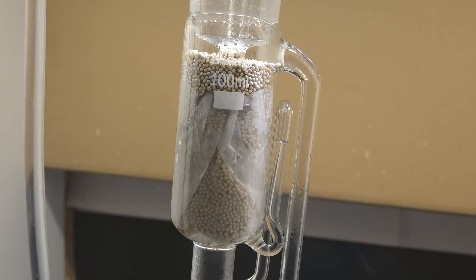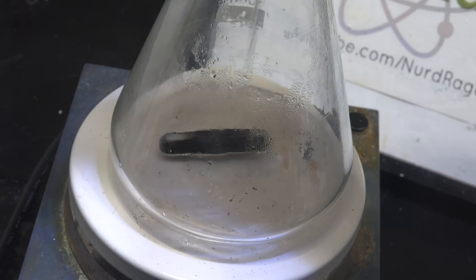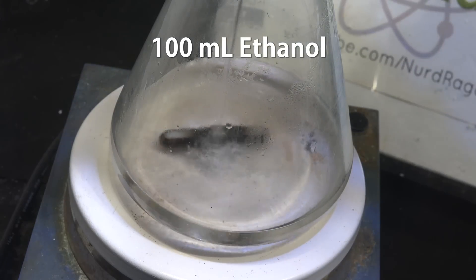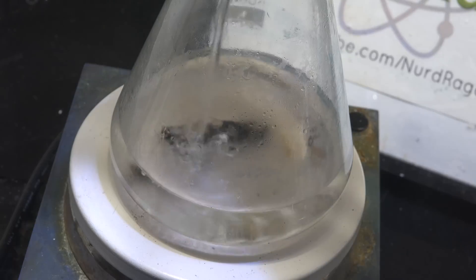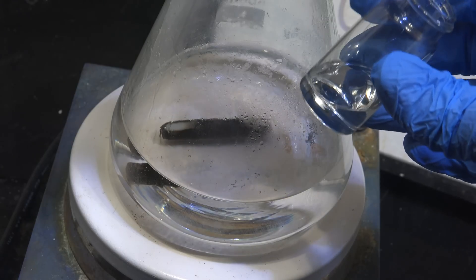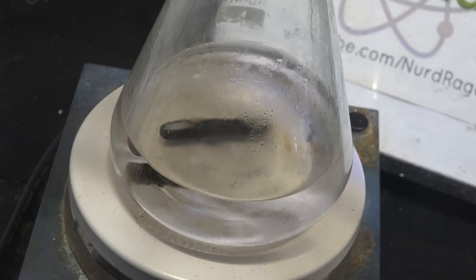In this video we're going to use it to selectively remove water with molecular sieves. First we start with an Erlenmeyer flask and add 80 mL of propionic acid, then 100 mL of ethanol. Normally you would remove any dissolved water first, but in this case we don't have to as we'll be removing the water during the reaction. Finally we need an acid catalyst — we'll use 4 mL of concentrated sulfuric acid. The process so far is just like regular Fischer esterification.